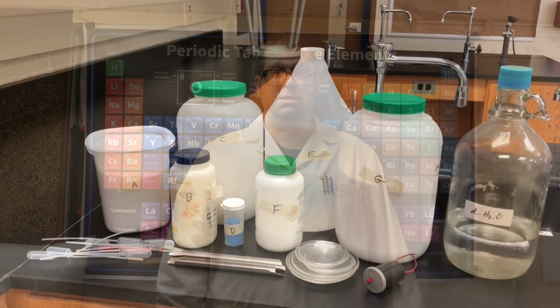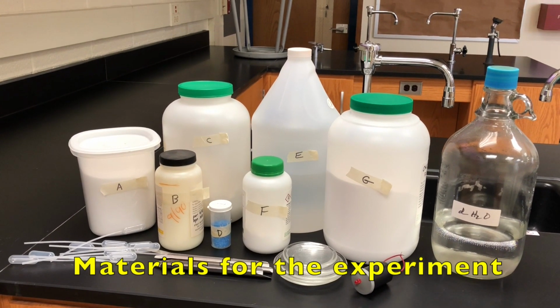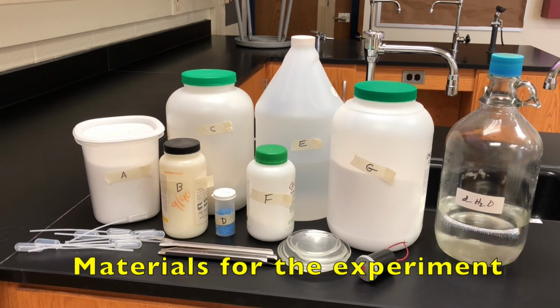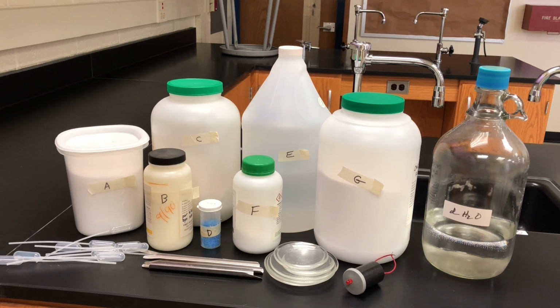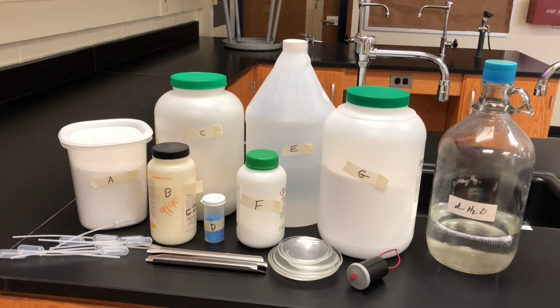So we're going to get into the lab, and I'm going to show you a series of tests that are used to describe what kind of chemical bonds are in which substances. Okay, so here we have all the materials for testing the types of chemical bonds that are in different unknown substances. They are labeled A through G.